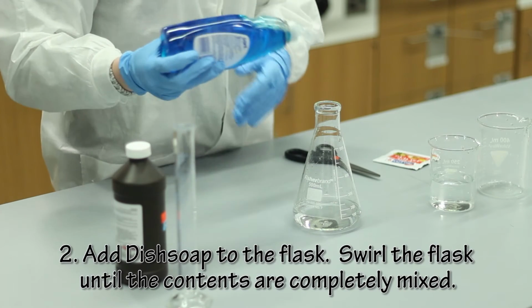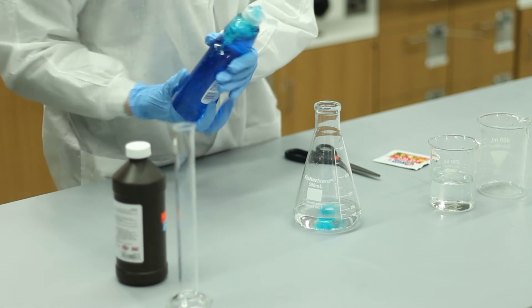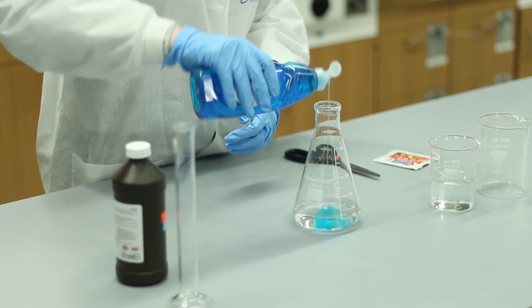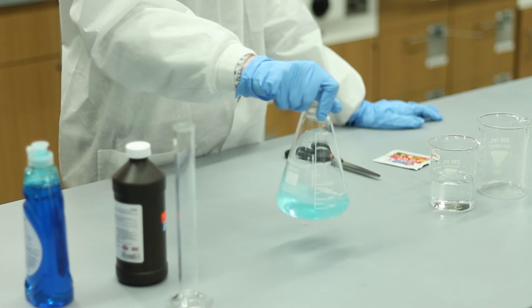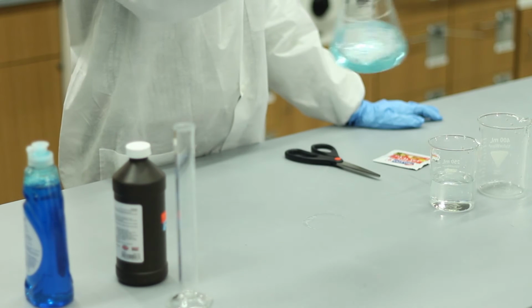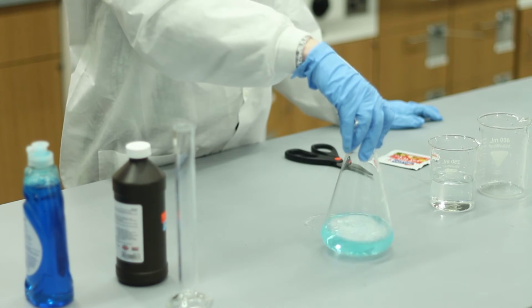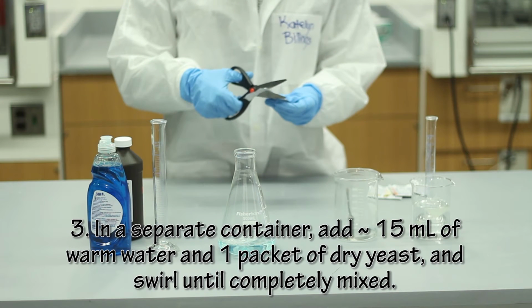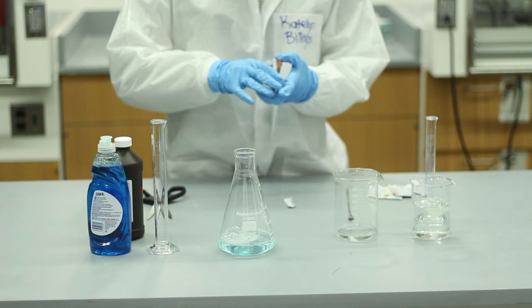Add dish soap to the flask and swirl until the contents are completely mixed. In a separate container, combine 15 milliliters of warm water and 1 packet of dry yeast and mix for about 30 seconds.